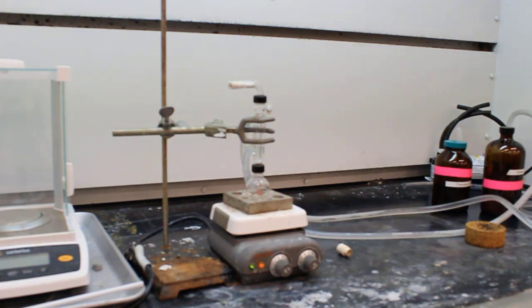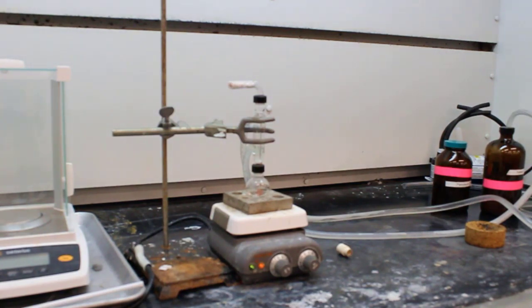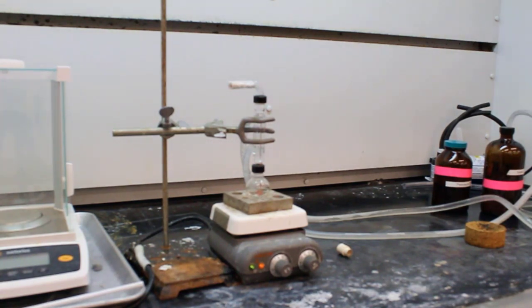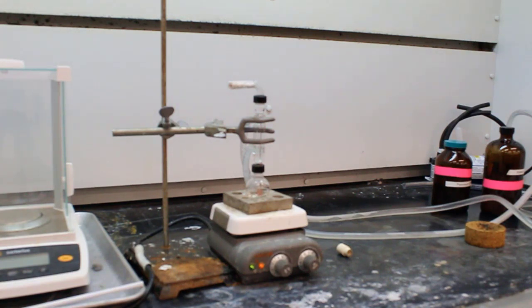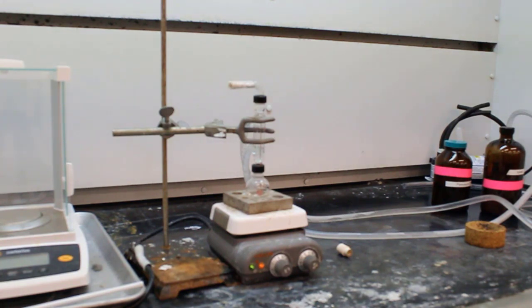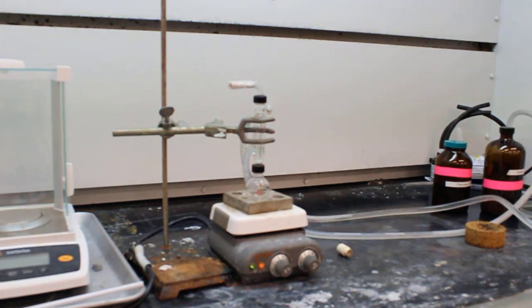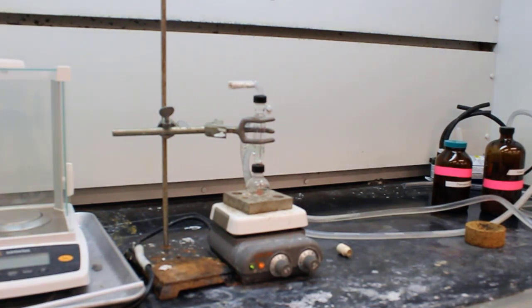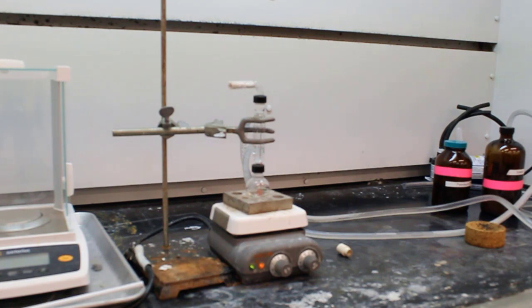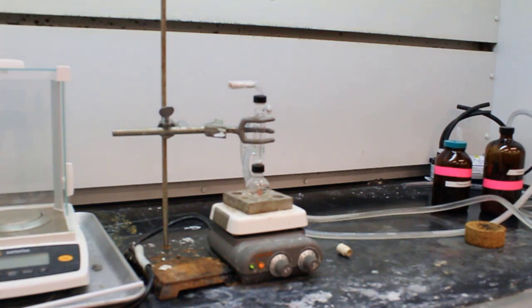In order to prevent this from happening, that's why we have this condenser — you can see that three-pronged clamp kind of grabbing it. It's a tube inside of a tube, with water running through it. The outer wall allows water to circulate around, cooling any vapors that collect up into the condenser and allowing them to condense back down and fall back into solution. If you are refluxing properly, you should not see a noticeable difference in volume from beginning to end.